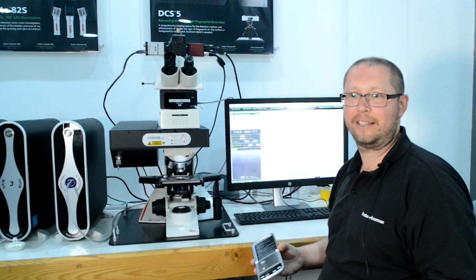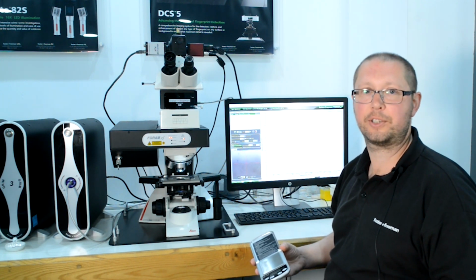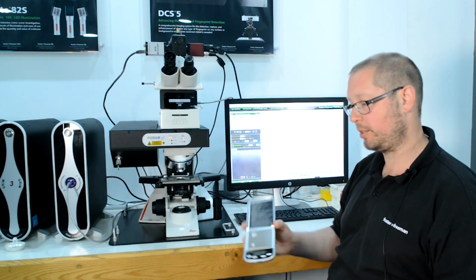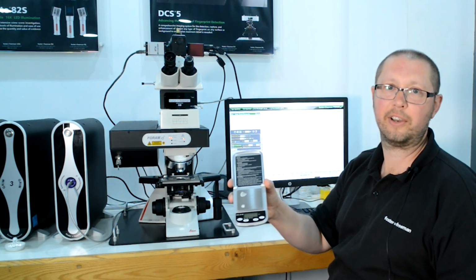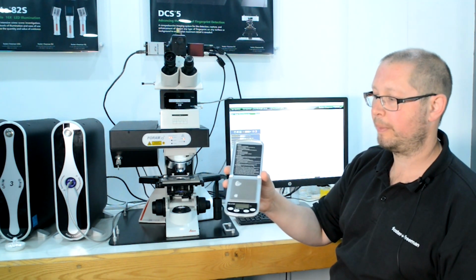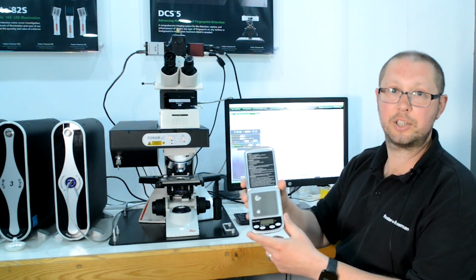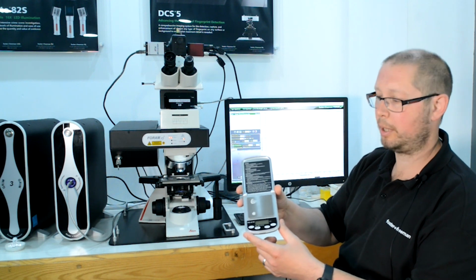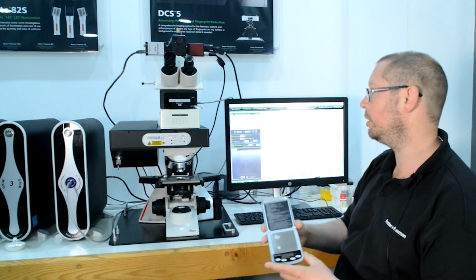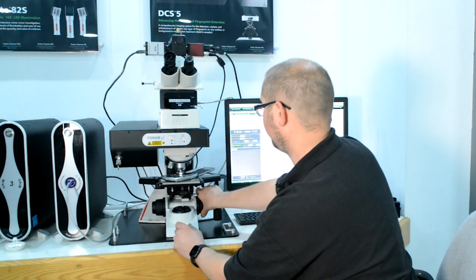So Raman, as a non-destructive, non-contact technique, can be suited for trace evidence analysis, and trace drugs falls into that category. So here we have a set of scales, fairly commonly encountered in drug scenarios, and on the scales there is some drug residue. In order to analyze this in situ without having the need to swab and potentially destroy or damage fingerprint information, we can place the scales into the sample area.